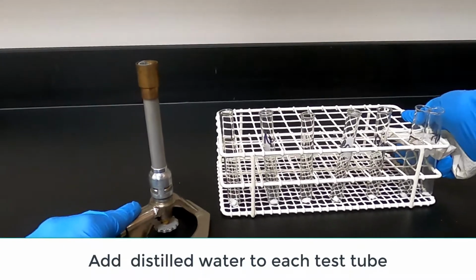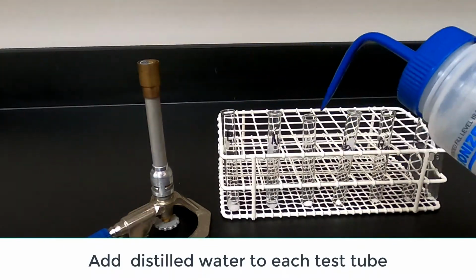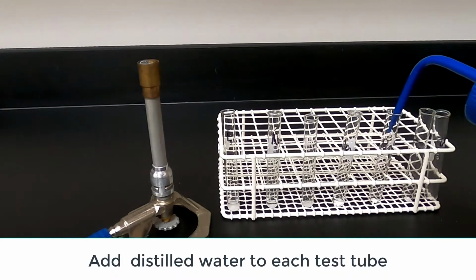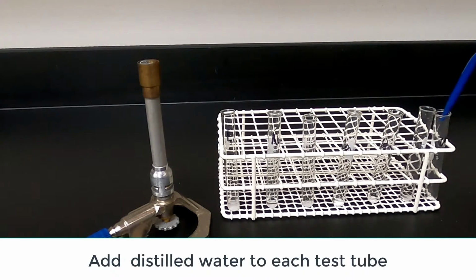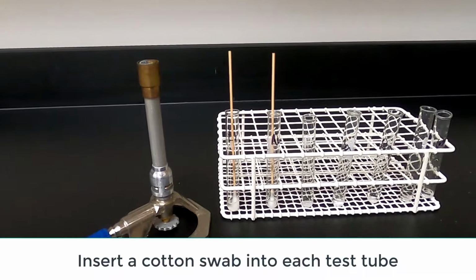Add about 10 to 15 drops of distilled water to each test tube. Insert a cotton swab into each test tube, cotton side down, and allow the solution to absorb into the cotton.